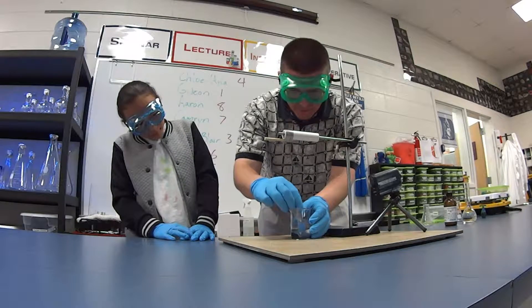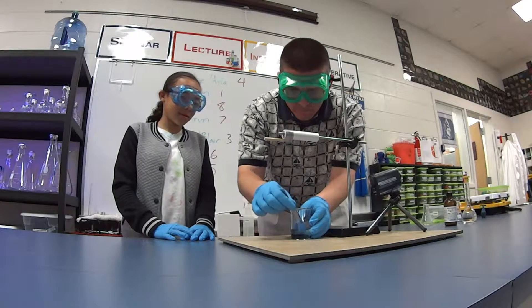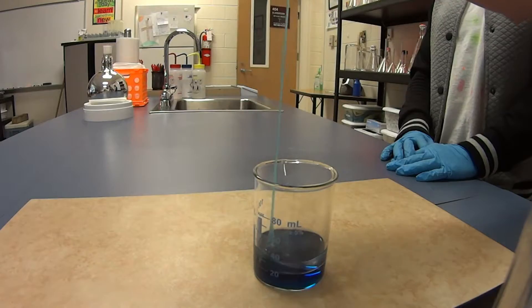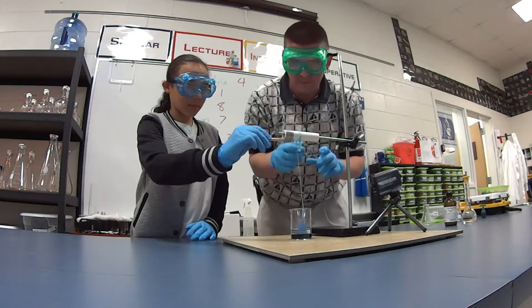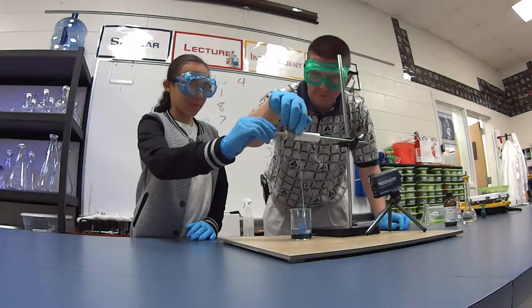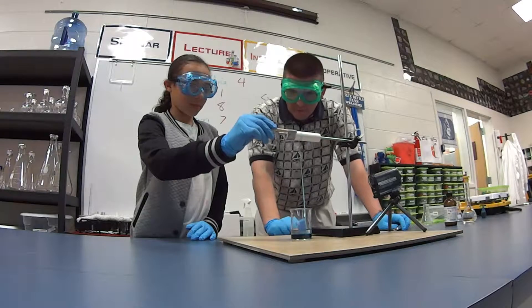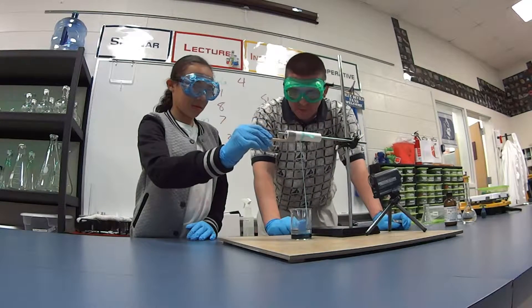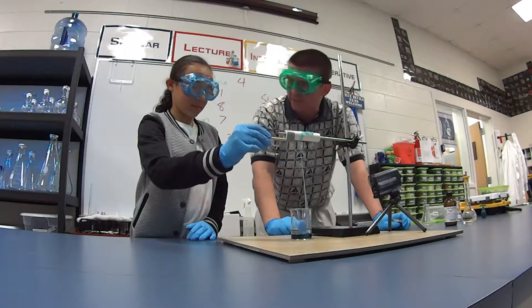Let me see if I can grab a piece of that and get it started here. There it comes — out and up and over. Go ahead and start turning the spool, just nice and slow and smooth. Let's get that wrapped around and keep turning. So what do we have now? We had two liquids, and now what's coming out is a solid. So we know a change has taken place.